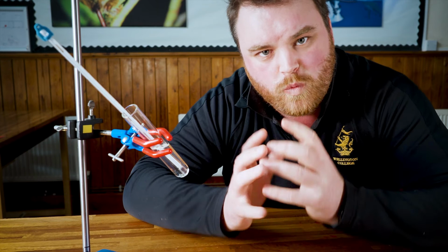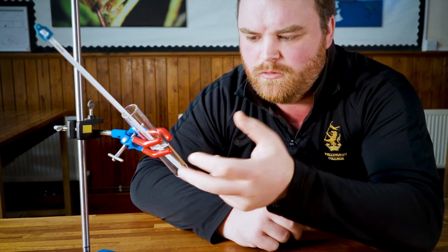Well, to answer that, we need to have a look at our equipment. This is a great experiment to evaluate simply because there are so many sources of error. When we burnt our biscuit, for example, was all that energy released as heat? Well, no. The flame produced light too, which didn't go into the water. Did all the heat transfer to the water? Well, no, again, some went into the surrounding air or the glass of the tube. And when the sample finished burning, had all the energy been released? Well, again, probably not. There must be some energy in those leftover embers.